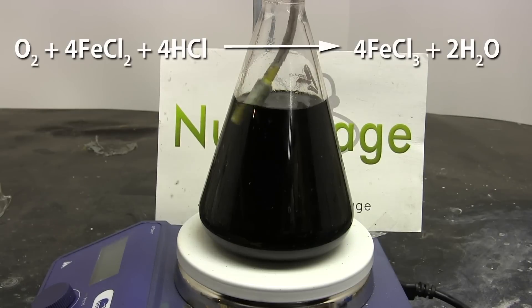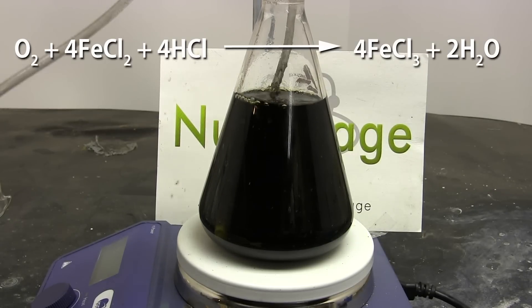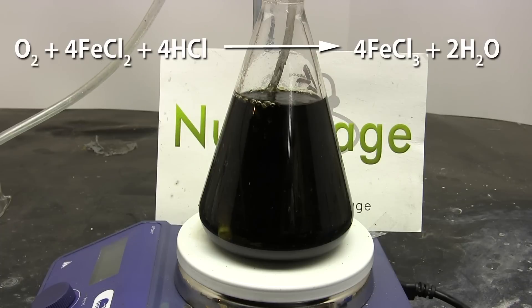What's happening is the oxygen in the air is reacting with the iron 2 chloride and hydrochloric acid to produce iron 3 chloride, also known as ferric chloride.